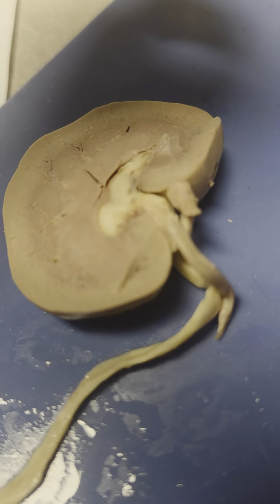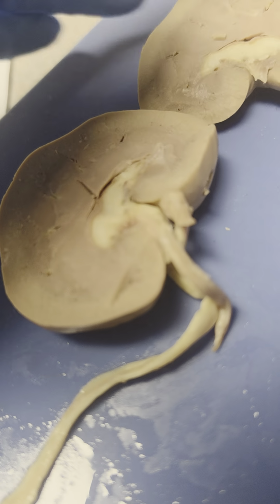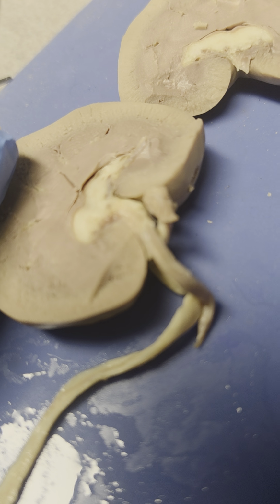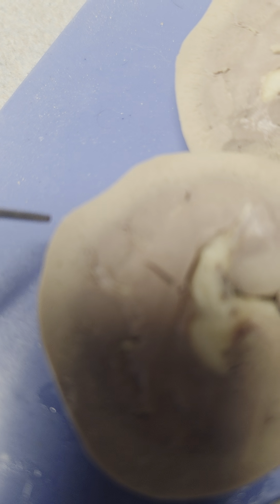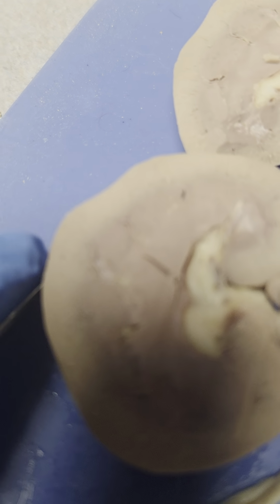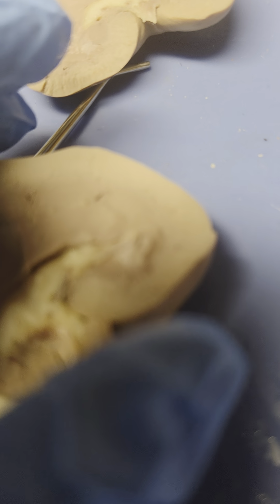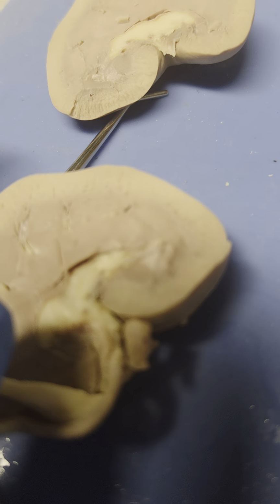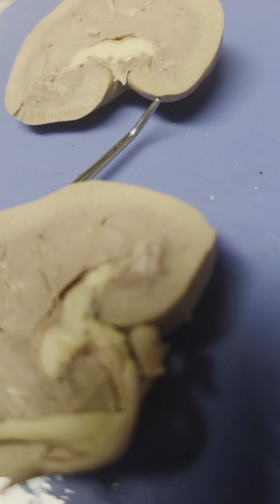And then moving onward, still internal, now we're ending with the renal capsule. So the renal capsule is like the very tip of this, on the outside, closer to the exterior portion. The renal capsule is a dense, irregular connective tissue layer that protects the kidney and helps maintain its shape.